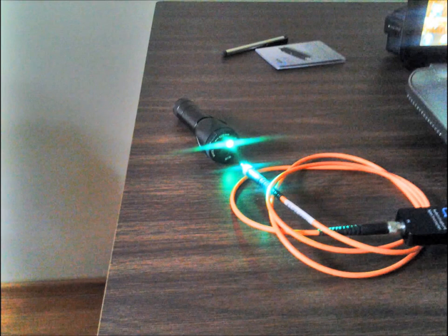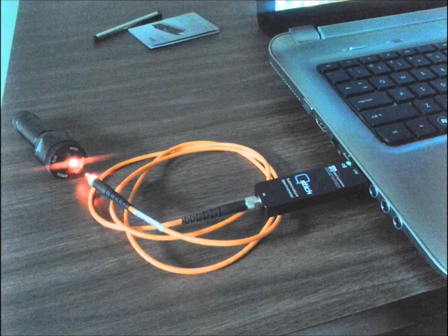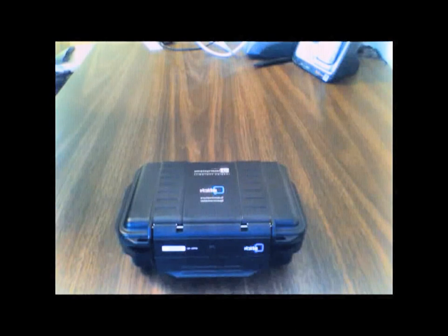The next thing we're going to do is test the Q-Stick with a reference light source. As shown here, this is what we're going to be using — it's a low-power LED flashlight that emits red, green, blue, and white light. Very low power, and that will be very sufficient for this test run just to see how it works.